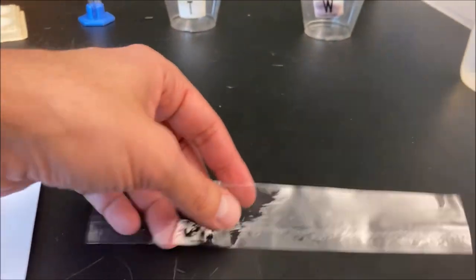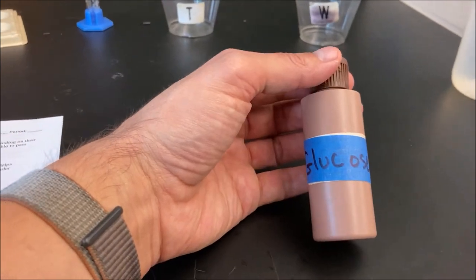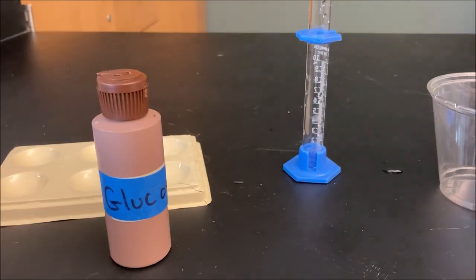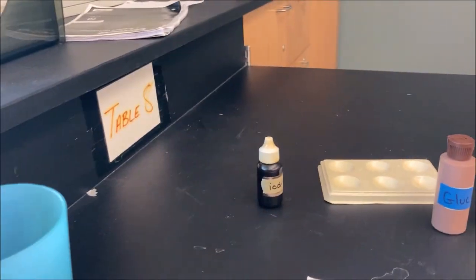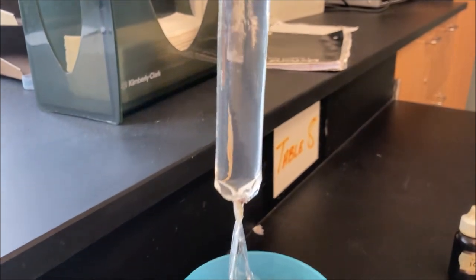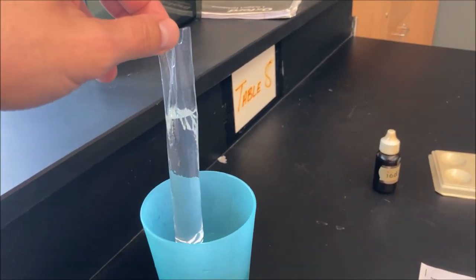What I need to do is soak this dialysis tubing. I'm going to take this bottle of glucose and measure five milliliters with my graduated cylinder. I'll add five milliliters of glucose and five milliliters of starch — so ten milliliters total — and pour it into a new dialysis tube. I'll put the camera down and do that right now.